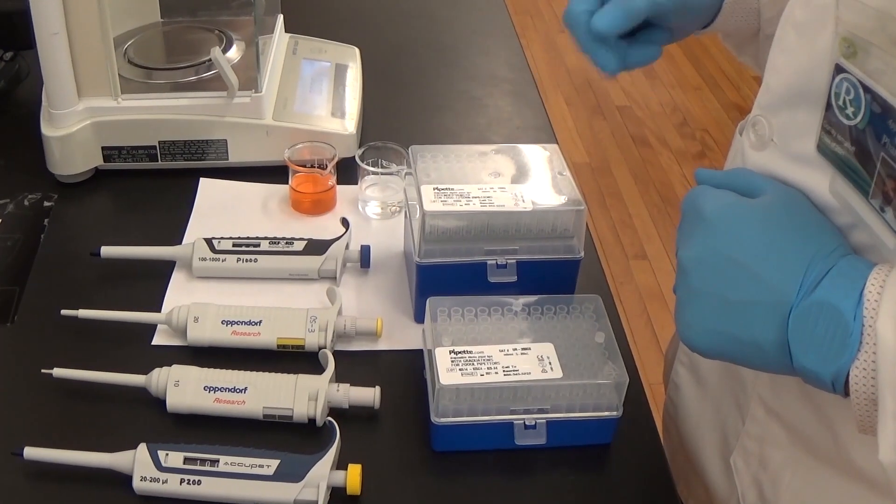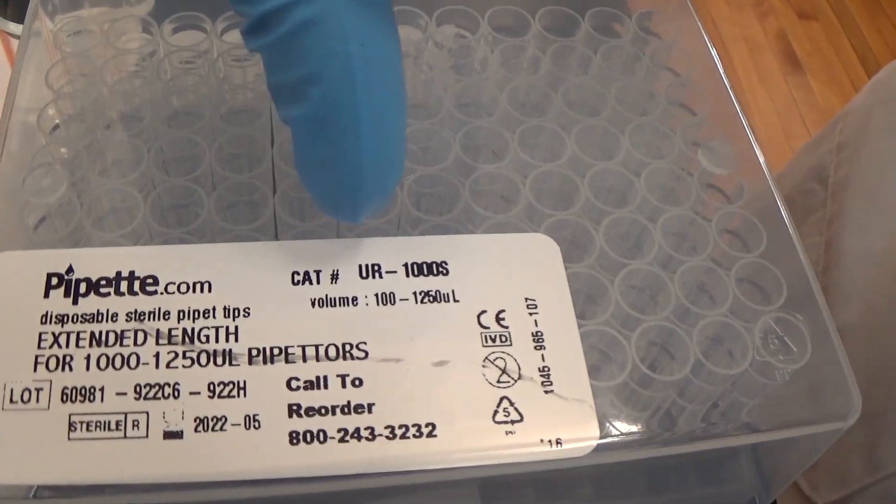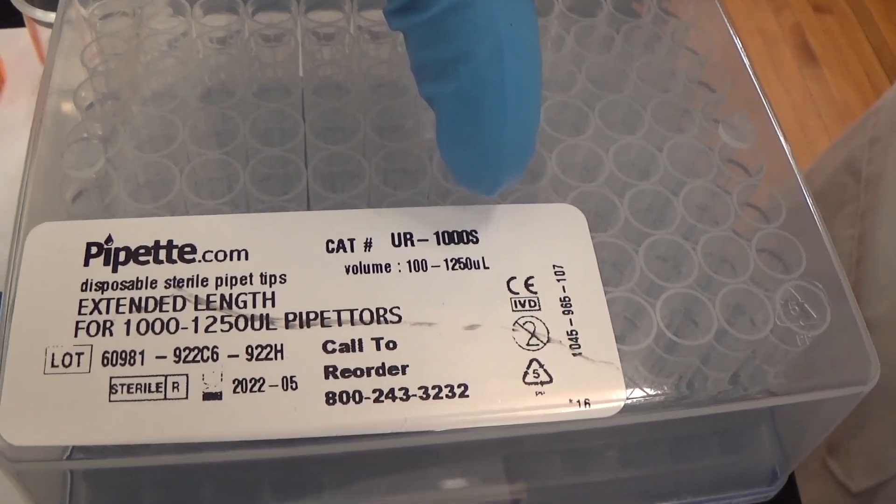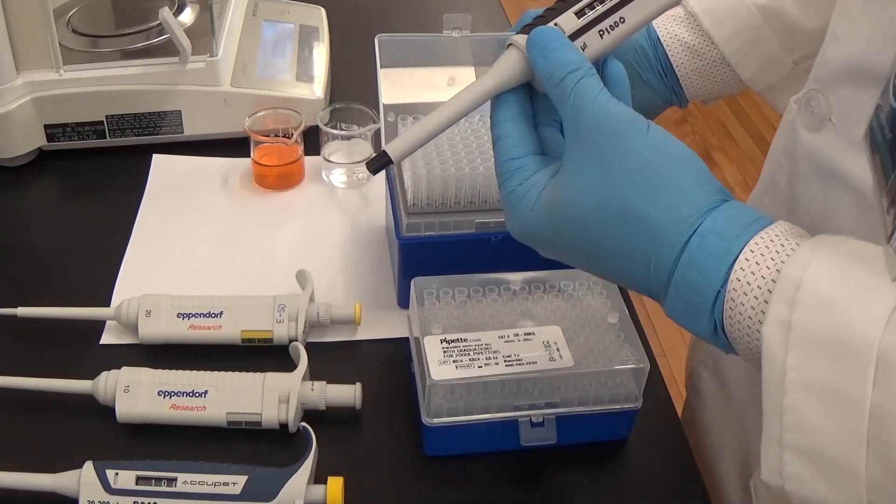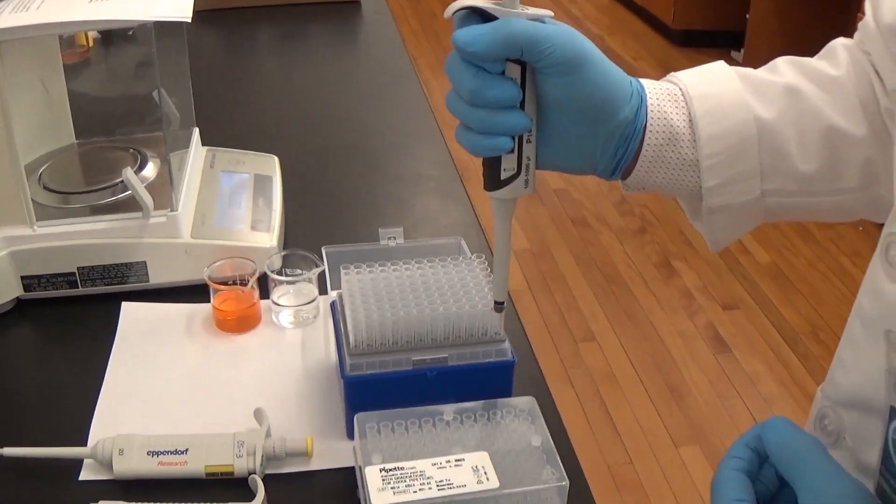These are the micropipette tips which come in various sizes. You must choose the correct size of tips for your micropipette. You should insert the micropipette shaft into the tip by pressing down firmly. You should also never touch the tips with your hands.